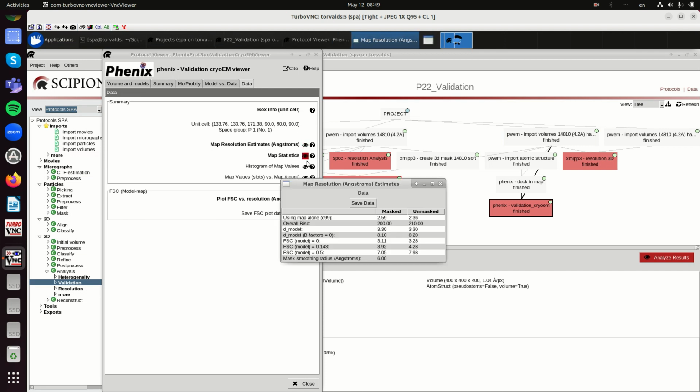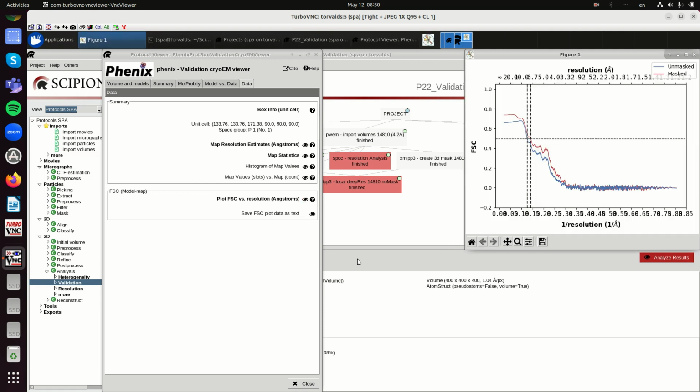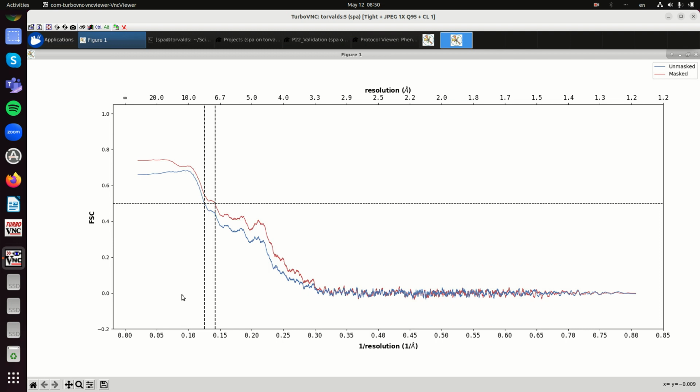There are a few of them, and you see that it is quite variable. You have values from 2.4 to values of 8. So the number that you choose is really important. It is not written in stone; that number is measuring mostly the consistency of your process. For instance, here if we compare the FSC of the map with the model, we see that it is somewhere between 7 and 8 angstroms. Below that they don't correlate.